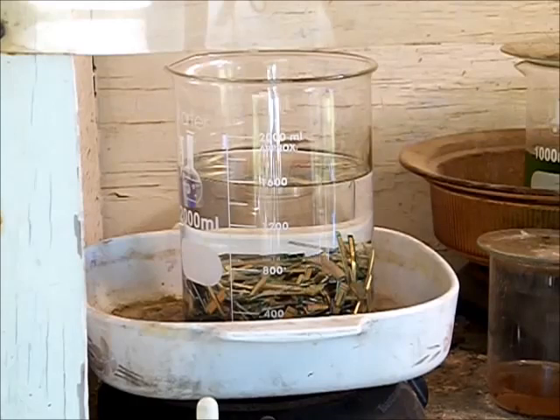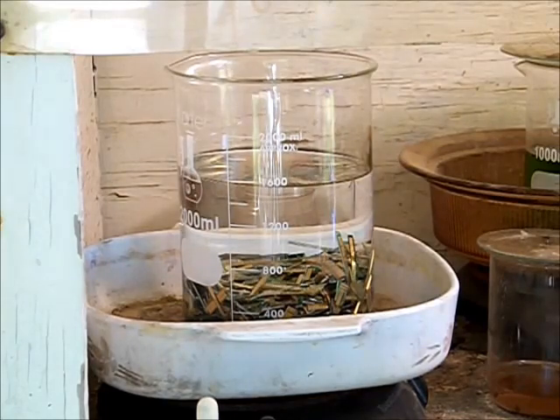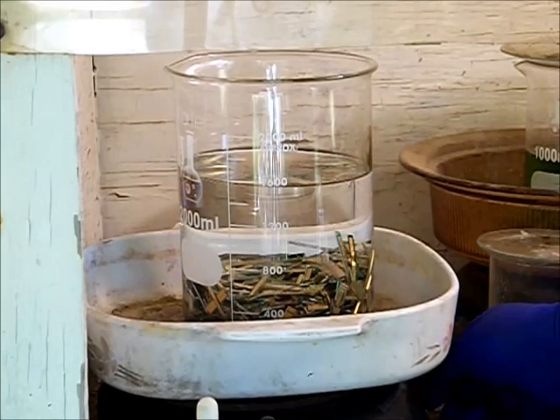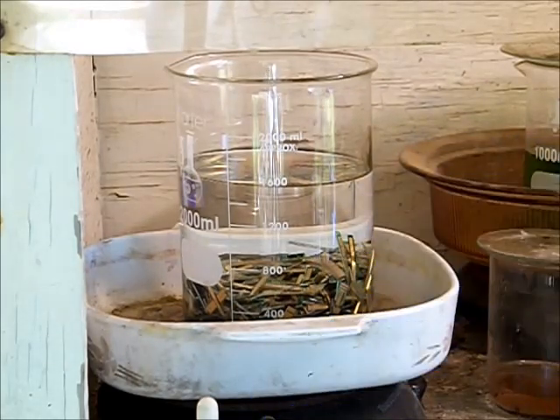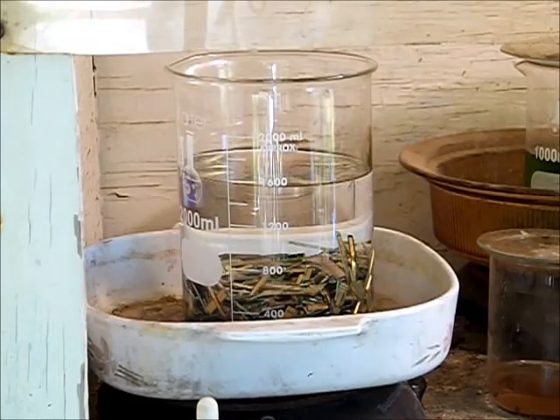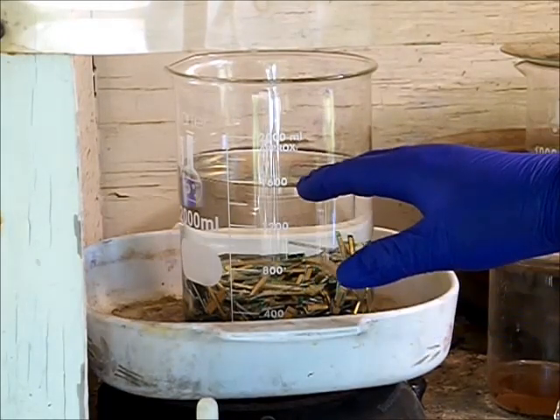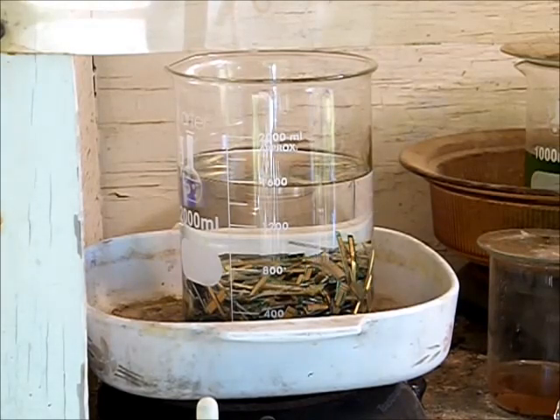Heat is required. You want to start out by heating your water, so we're going to turn this on. It doesn't have to be hot to start the process, but it has to be hot for the process to continue.